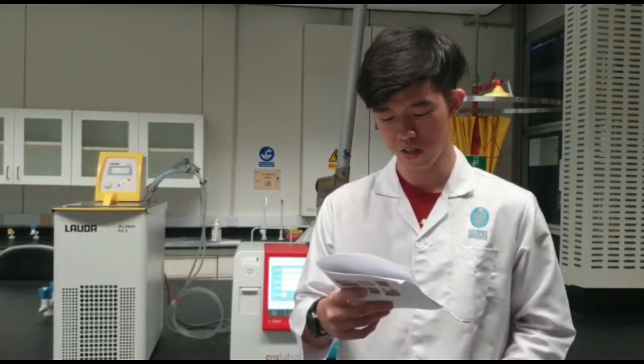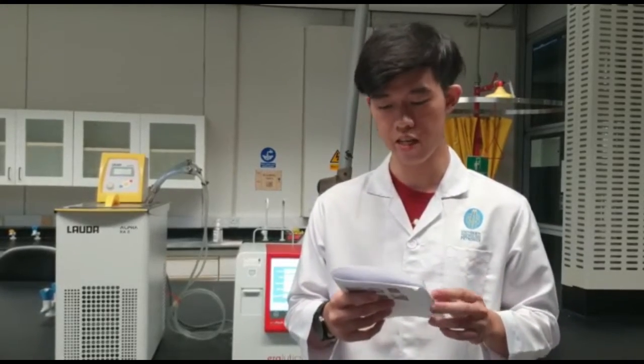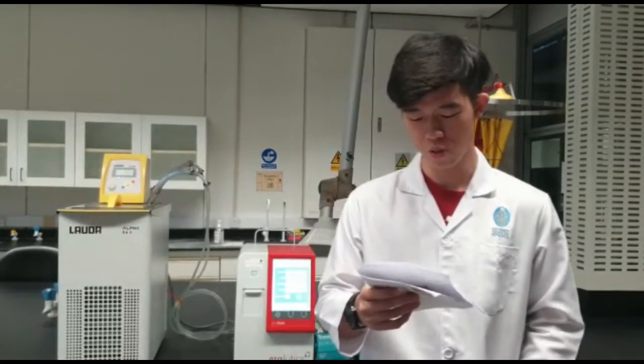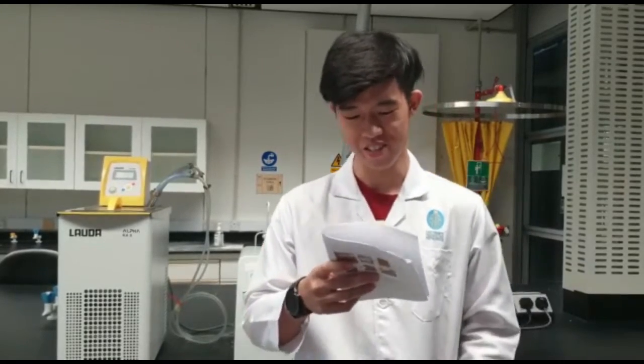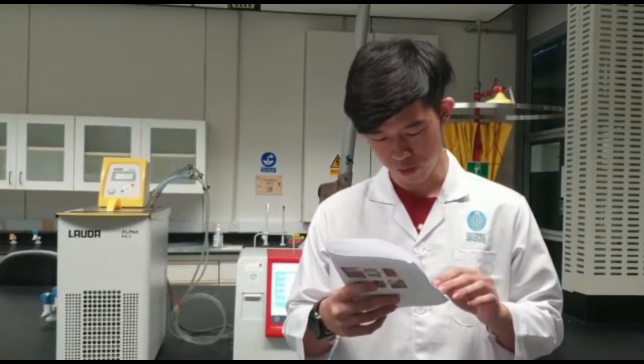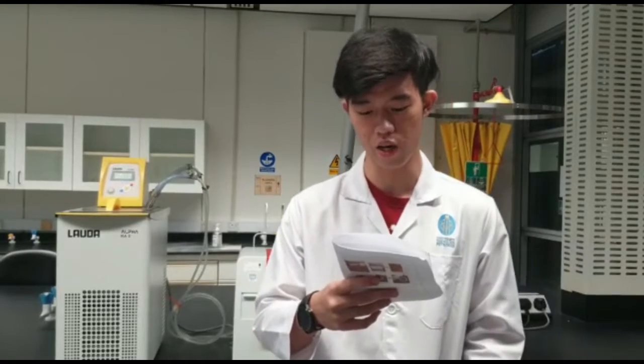For the second part, we compare ASTM D93 with ASTM D7094. For the result that we get, ASTM D7094 has a higher flash point compared to ASTM D93. The flash point that we get for D7094 is 78 degrees Celsius, while it is 76.2 degrees Celsius for D93A.